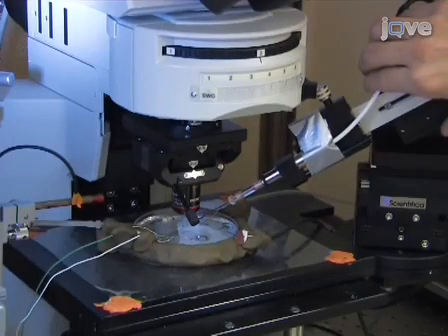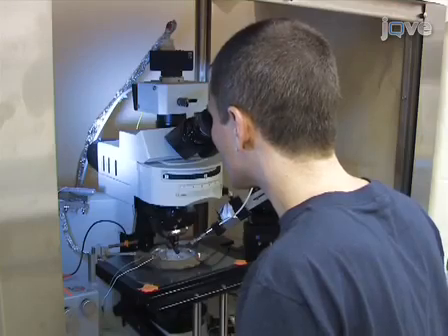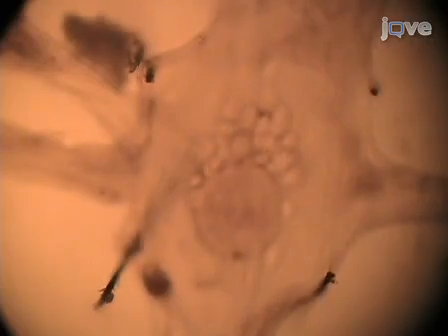Next, adjust the microelectrode to an oblique angle and position its tip above the stomatogastric ganglion. Lower the microscope objective until the electrode tip is in focus. Then, lower the objective, being careful to stop before touching the microelectrode. Then, lower the microelectrode until it reappears in the focus of the objective.